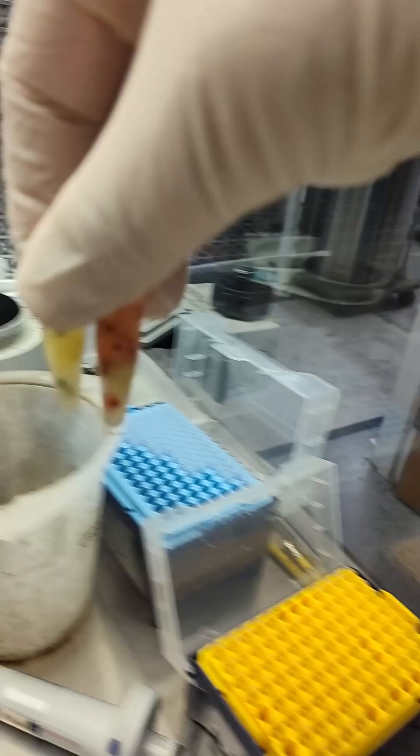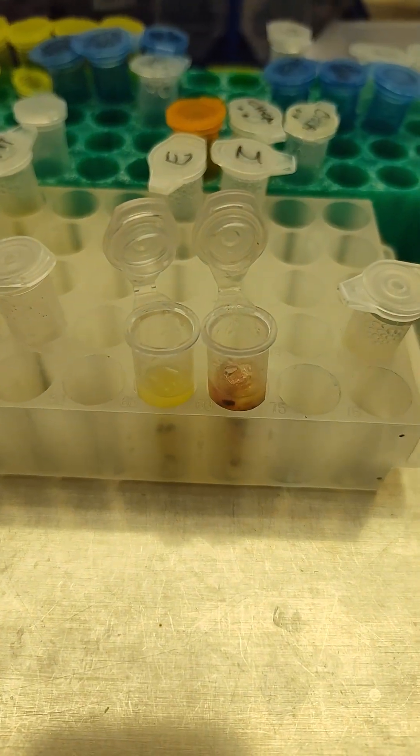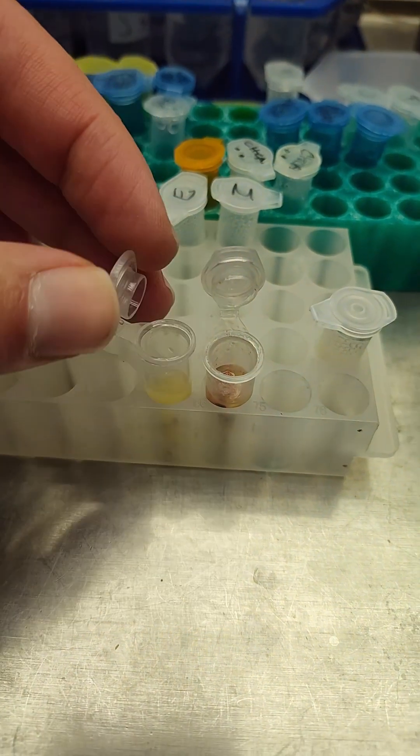Maybe I put a little too much in, but I really want to try to get that red color. And we'll throw it on the sonicator for a sec. That's finally down at the bottom there. You can see I got way too much kiwi. It's like a mil of kiwi.